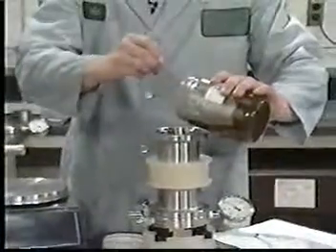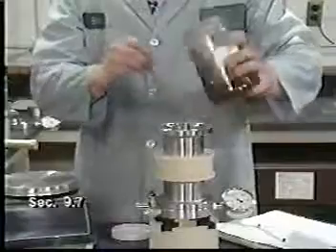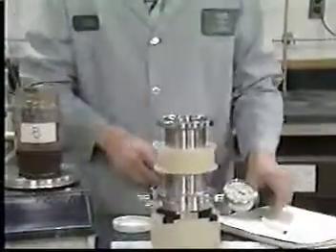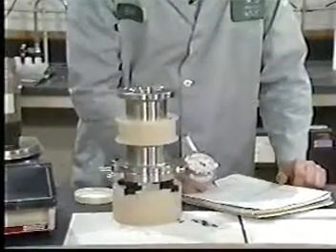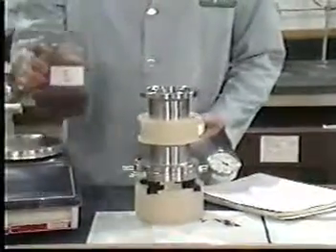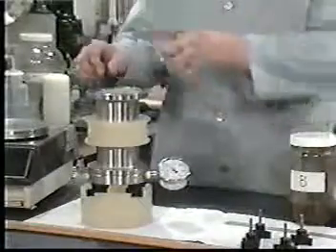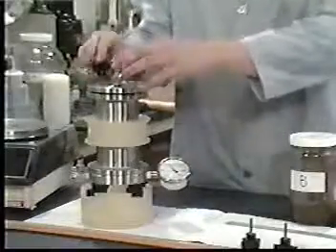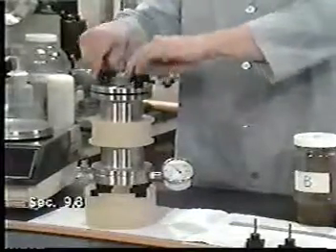When the particle size is appropriately small, quickly transfer the entire sample, both liquid and solid phases, to the ZHE. It is not advisable to centrifuge wastes prior to filtration unless it can be accomplished in the original sample container. This avoids loss of volatiles due to repeated transfer. Secure the filter screen assembly to the top flange and place it on the ZHE body. Tighten all fittings on the device and place it in a vertical position.